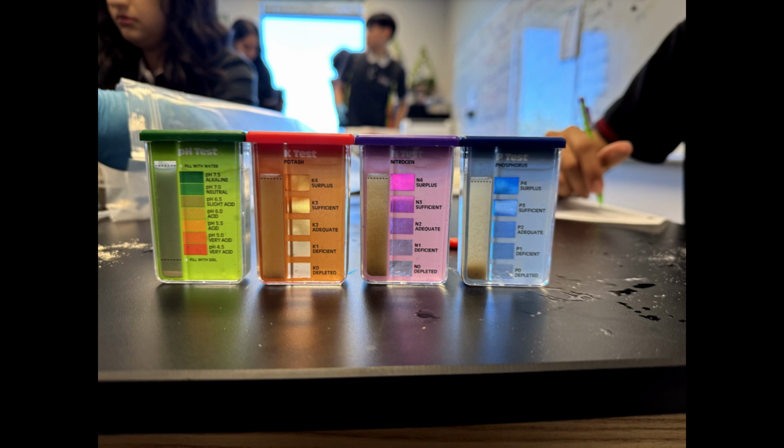The test for soil composition entailed a series of tests meant to check for pH and amounts of phosphorus, potassium, and nitrogen present in the given sample of soil. In our experiment, we got the following results. A pH of 6.5, slightly acidic. The pH value of 6.5 depicts that this soil is slightly acidic, hence within the optimum range which most plants require and which normally ranges between 6 and 7.